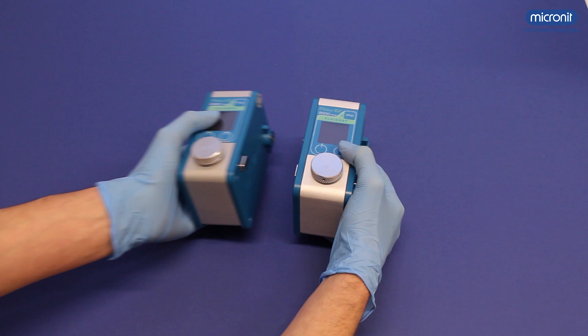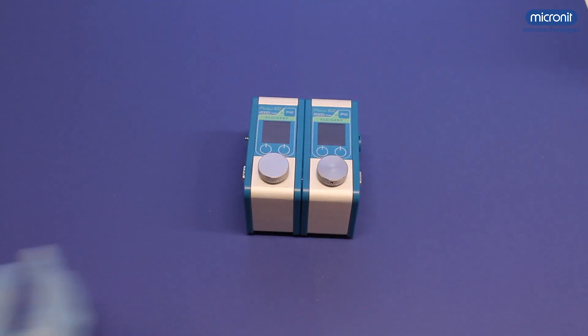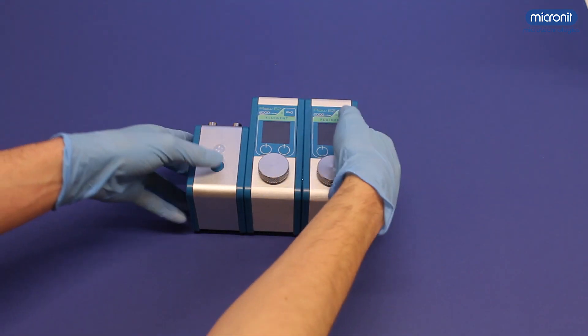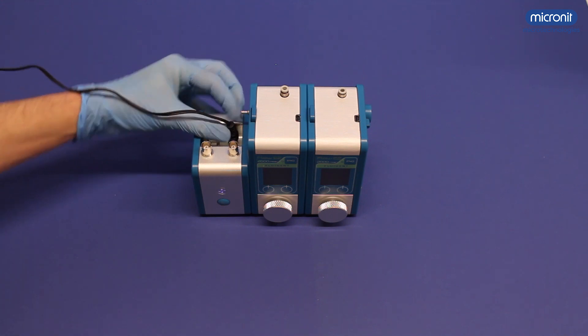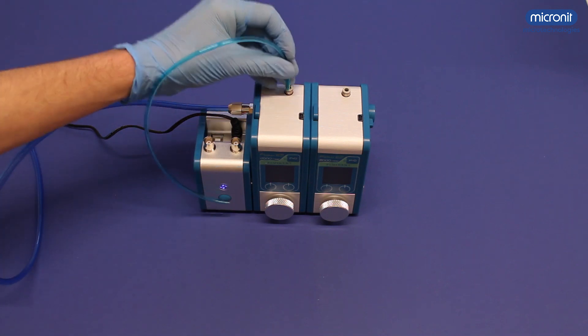To start the assembly, click the different pumps together. Add the link module, connect the power supply, the air pressure supply, and plug the tubing.